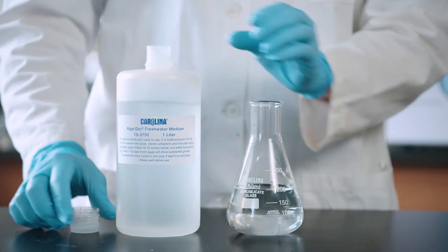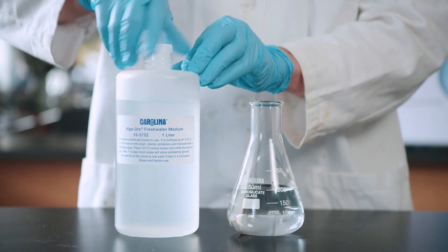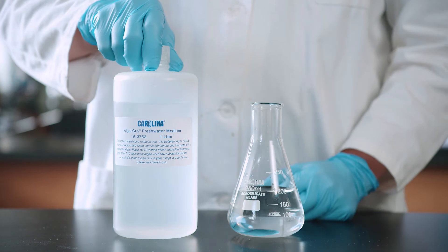We are using AlgaGro freshwater media for this example. However, ensure you are using the correct media for your algae species.